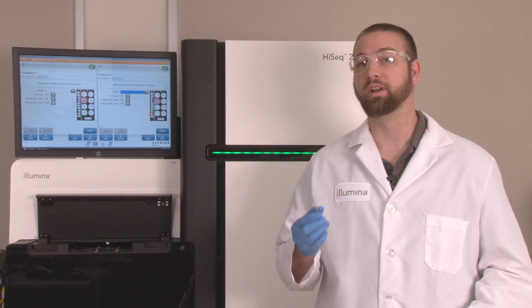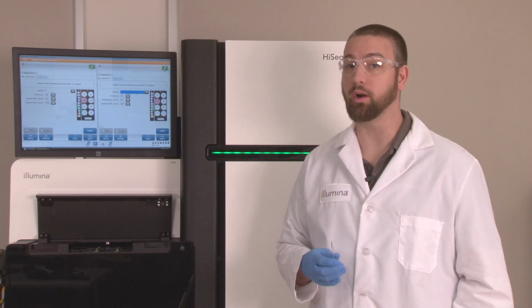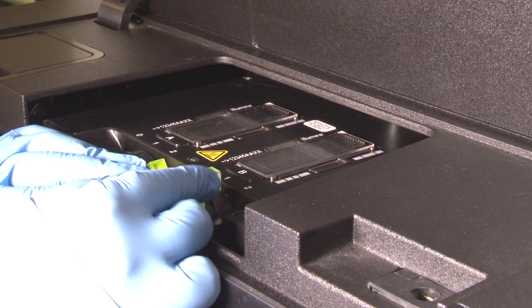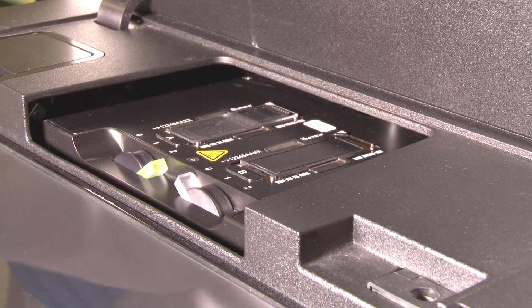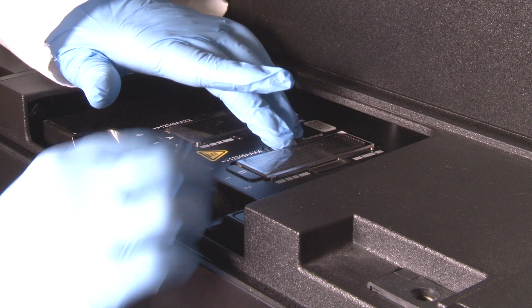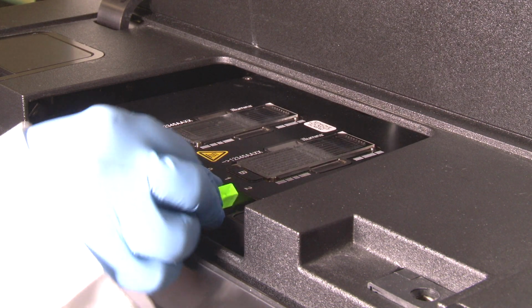Thanks, Chad. When staggering runs started on flow cell A and flow cell B, setting up a new run automatically pauses the current run on the adjacent flow cell. The flow cell currently running is placed in a safe state by the control software, allowing you to set up the sequencing run for the second flow cell. Illumina recommends setting up the second flow cell while the currently running flow cell is in a chemistry step. This prevents any difficulties that may occur when stopping the process mid-imaging.